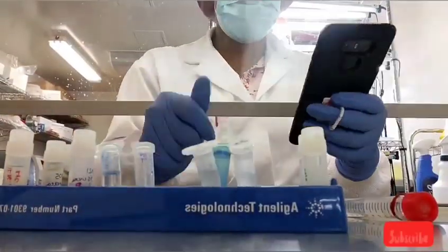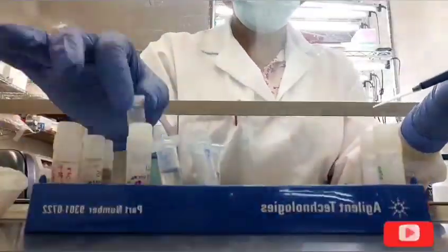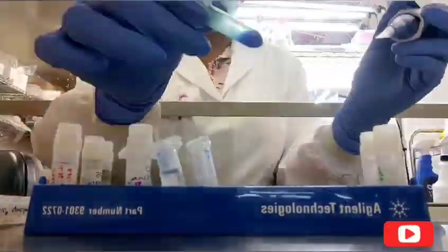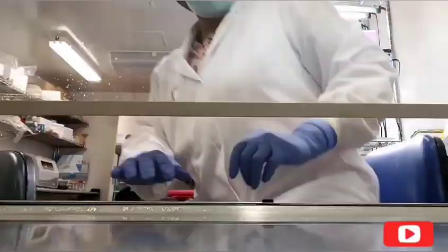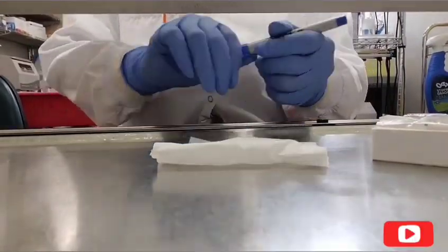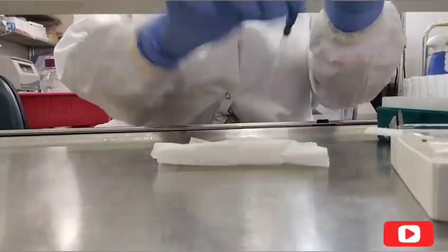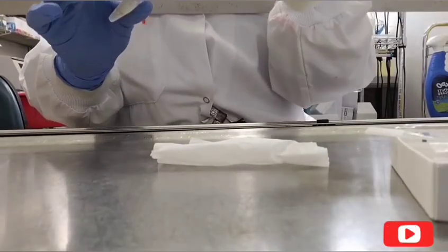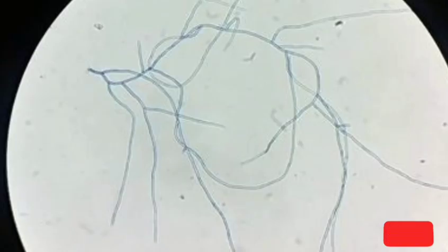under the microscope. I'm going to add 10 microliters of each of the isolates and then 10 microliters of the dye that should stain any fungal particles present blue. Once I'm done, I will look under the microscope to see, and essentially I'm looking for hair-like structures. That will be hyphae, and I think the spores should be round, but I don't know if any of these vials contain spores. So here you see there's none here, but you can see the hair-like structure in this one.